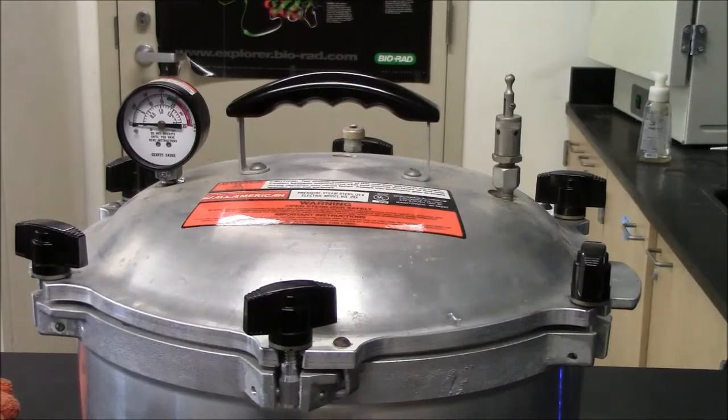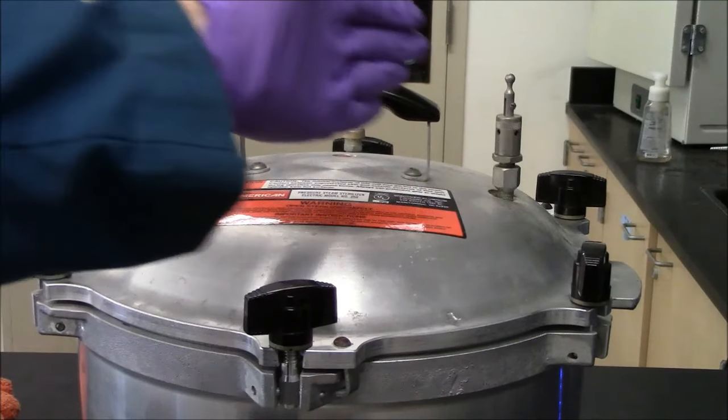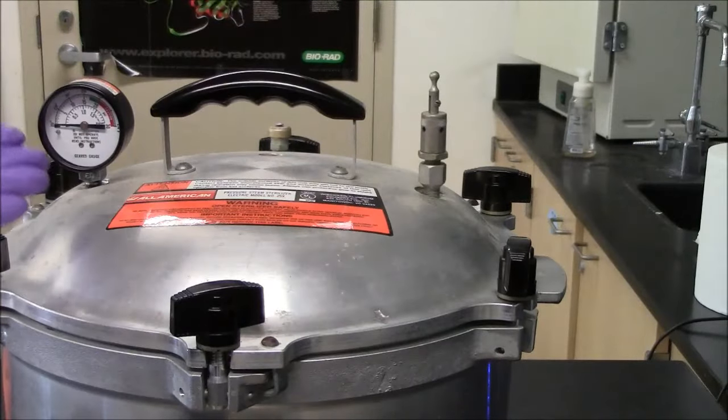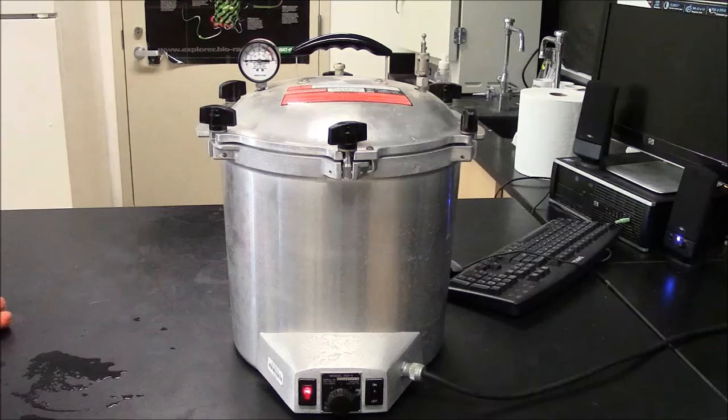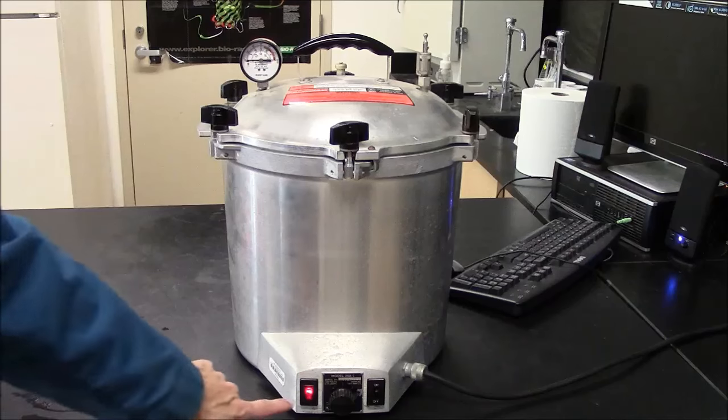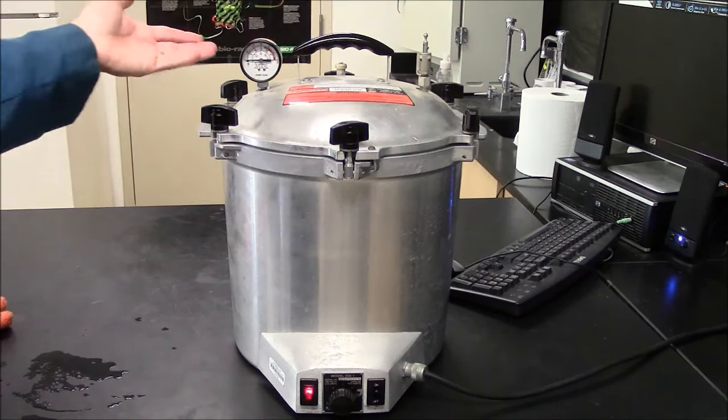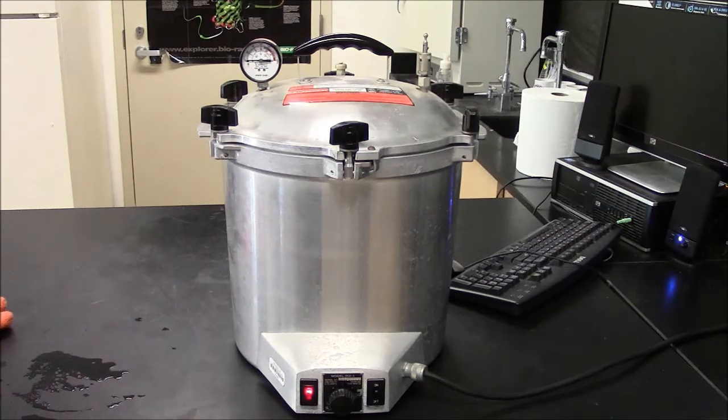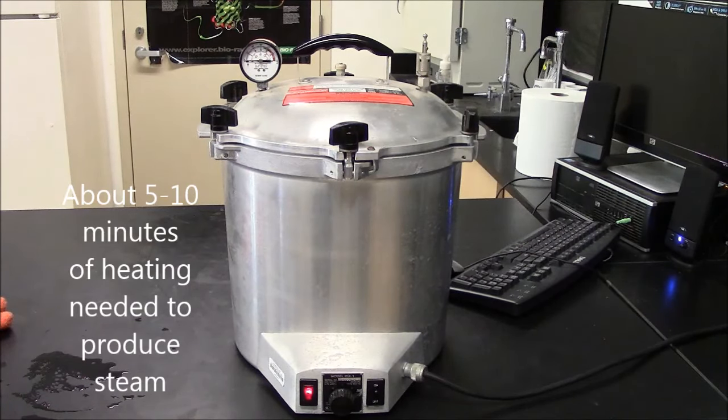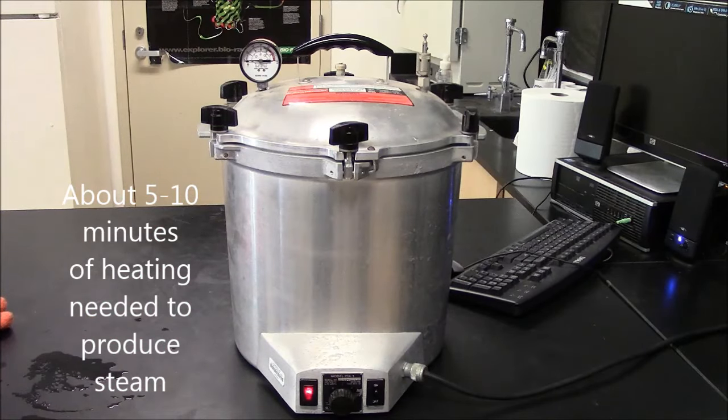Steam exits from this valve here. And I need to let the steam escape for about five minutes before I close this valve and let the pressure start to rise. This is a waiting game now. Heating is on. Valve is open. Pressure is reading zero, meaning it's the same. It's one atmosphere inside and outside, which will be the case as long as this valve is open. I'm just waiting for the steam to appear.